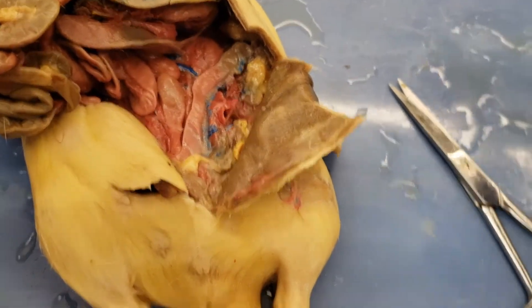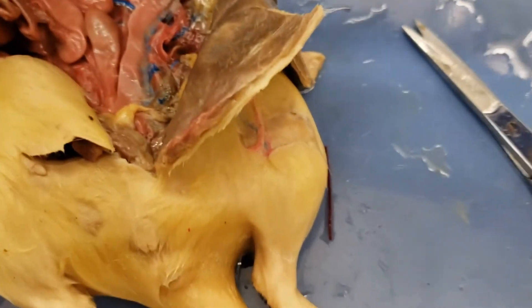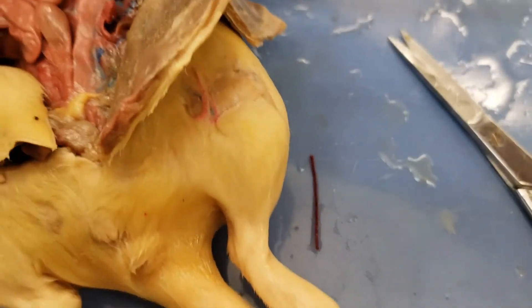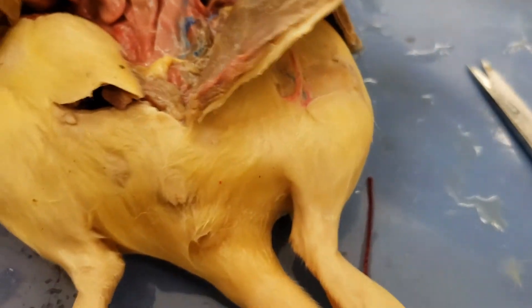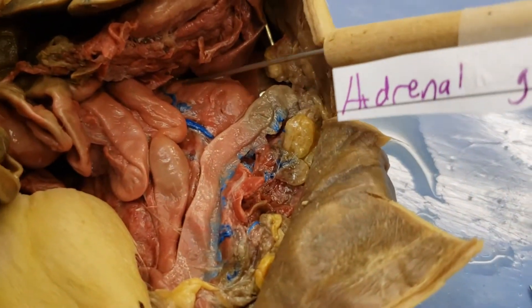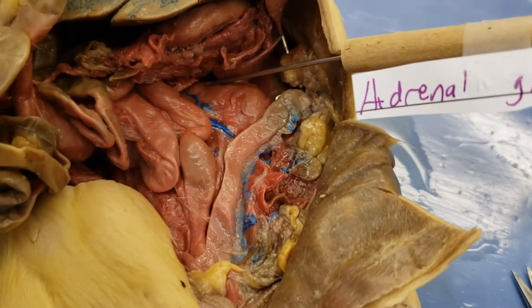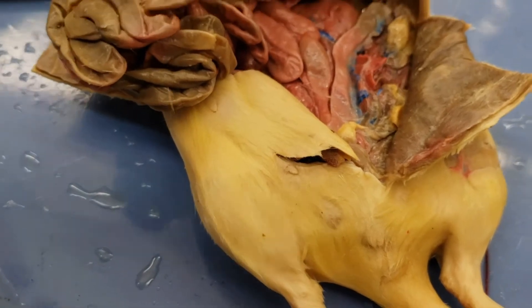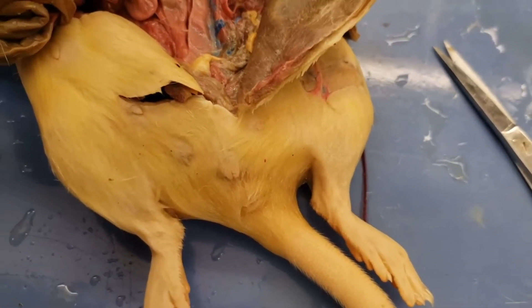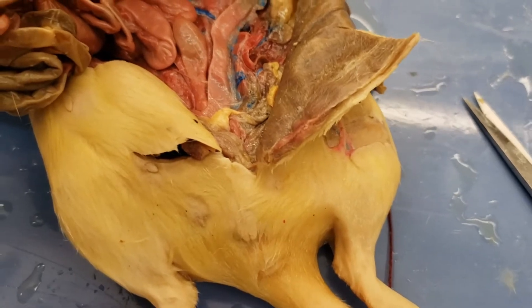The kidneys have a sidekick — the Robin to their Batman, the Bucky Barnes to their Captain America — and that would be the adrenal gland. The adrenal gland is like a little hat that the kidneys wear. You can kind of see it up in this region — it kind of rests on top of the bean-shaped kidney. The adrenal glands are involved with hormones too. For a small structure, they have three different layers and they respond to a hormone called adrenocorticotropic hormone, then at the adrenal gland they can release a bunch of different things.